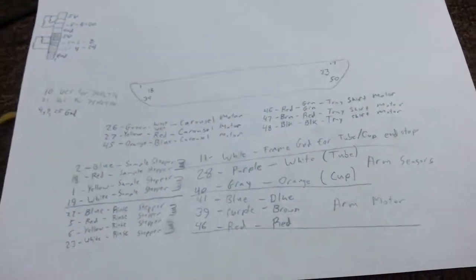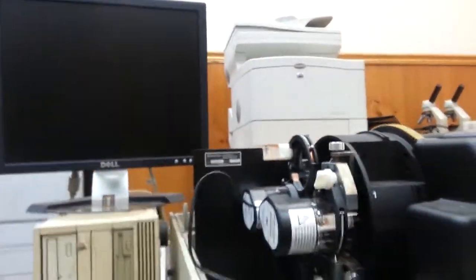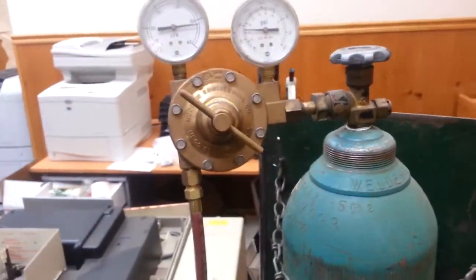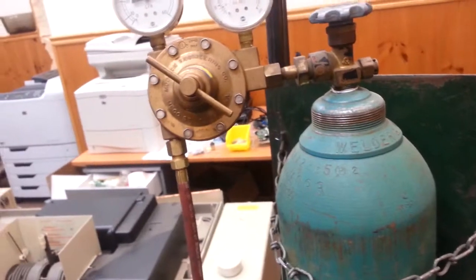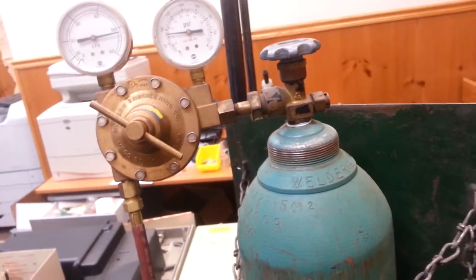So, what I'm going to do here is I'm going to power this thing up. And this time we got it hooked up to argon, which we'll hopefully get it past a few of the checks that it was doing before, because it would just keep telling us that the pressure was too low to continue. So we wanted to rule that out as being a cause of some of the issues that we were seeing.